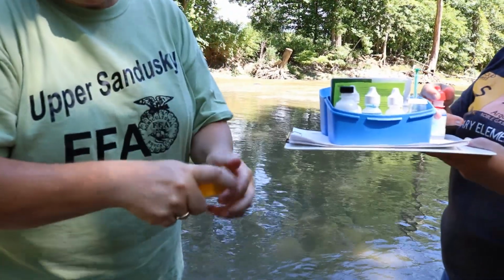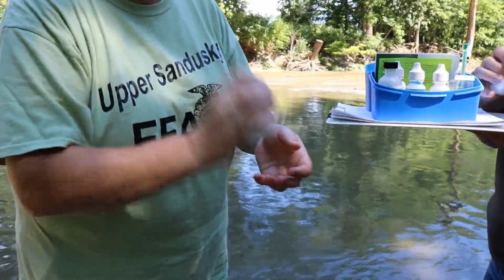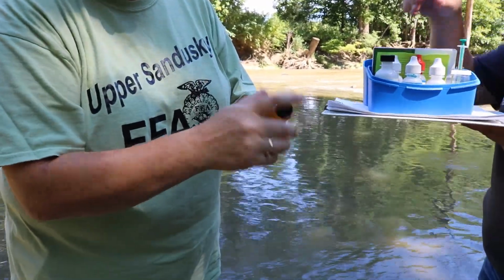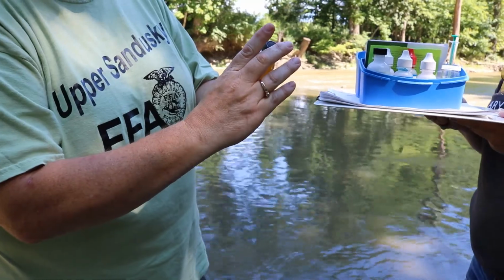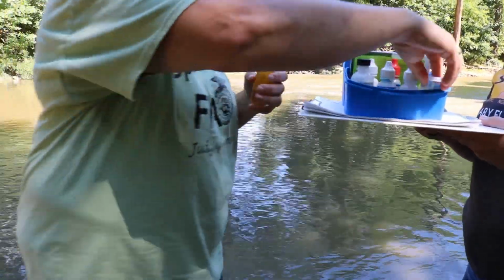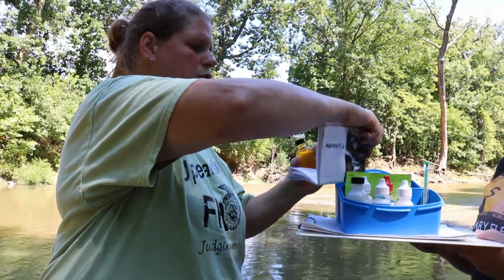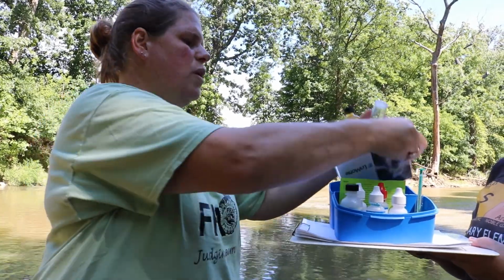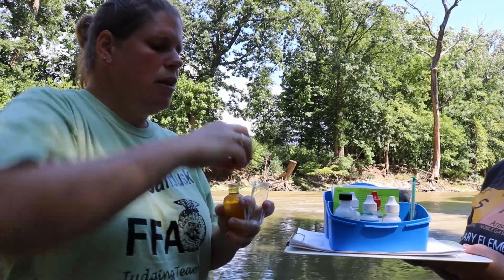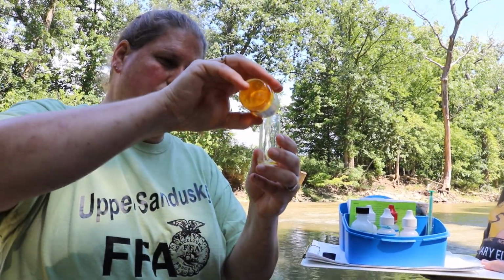Once you have this step done, then your oxygen is fixed, and we could go back into the classroom and test it, or we could do it right here in the field. I think I have it. Sometimes it takes really long. Now we're going to use our sample bottle, and I need to fill it to the 20 milliliter line. I've made enough sample here to be able to do this twice in case I mess up the first time.